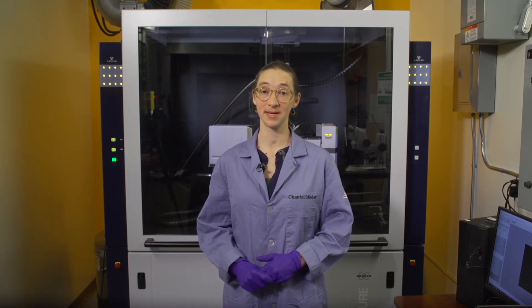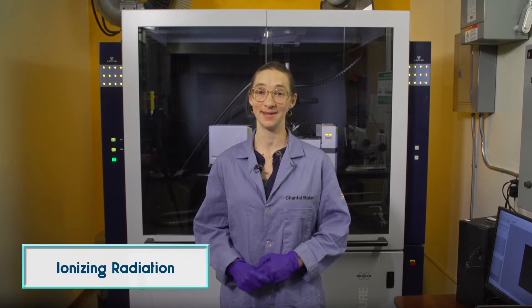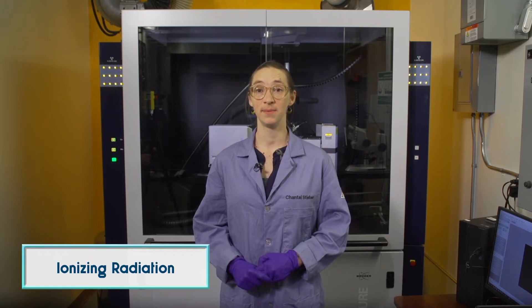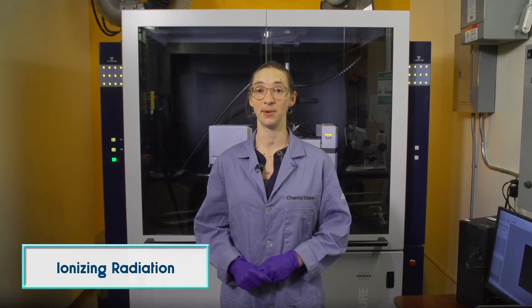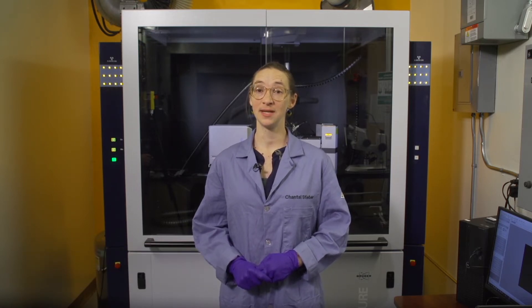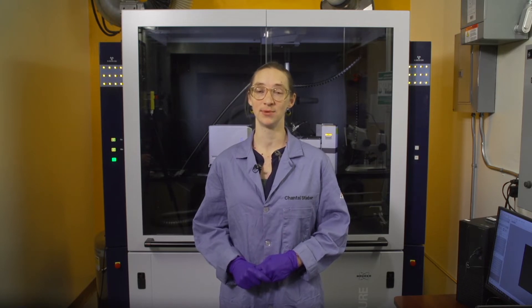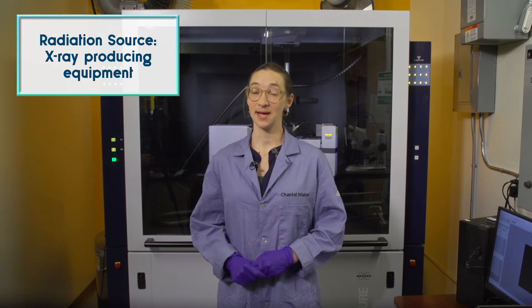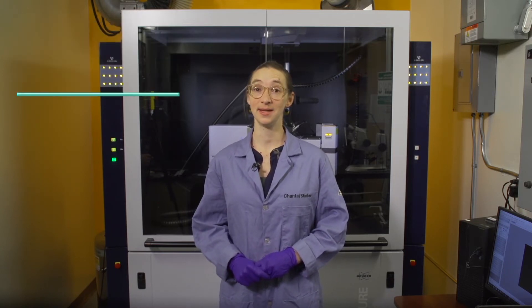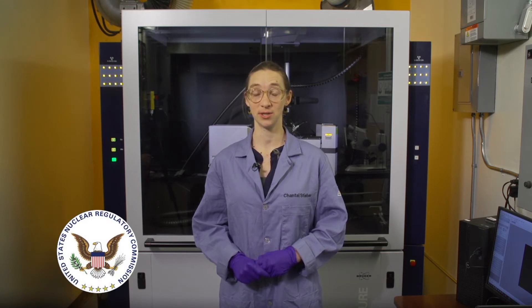The x-ray diffractometer has additional safety considerations because the instrument produces ionizing radiation. Only those who have been properly trained in radiation safety are authorized to use the x-ray diffractometer. We hope this video will offer an introduction to the instrument for those who are unable to directly use it. Radiation sources such as x-ray producing equipment are strictly regulated in the U.S. by the Nuclear Regulatory Commission, or NRC. Cal Poly Pomona additionally has a radiation safety committee that regulates radiation sources.